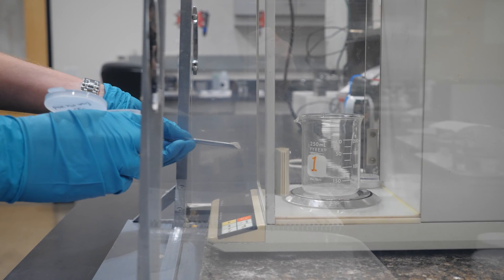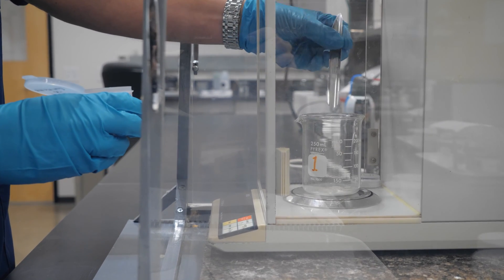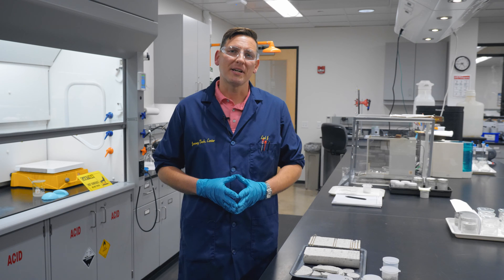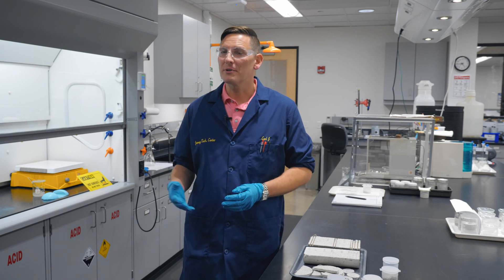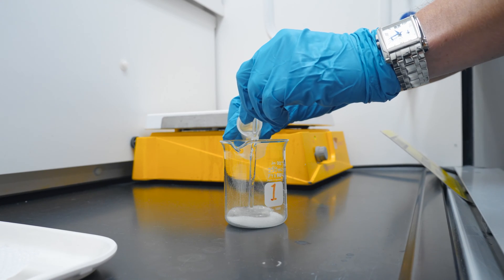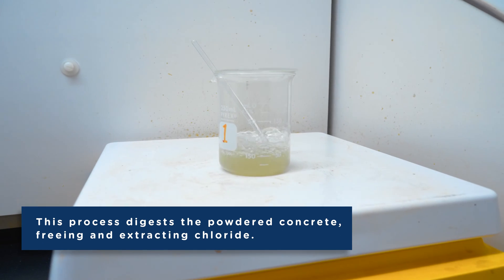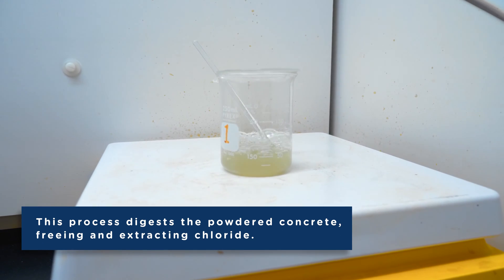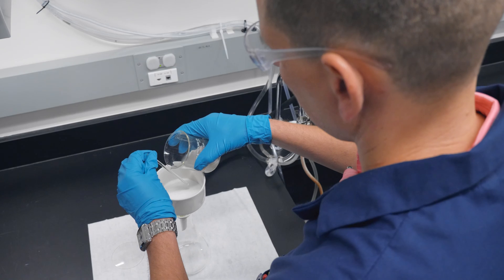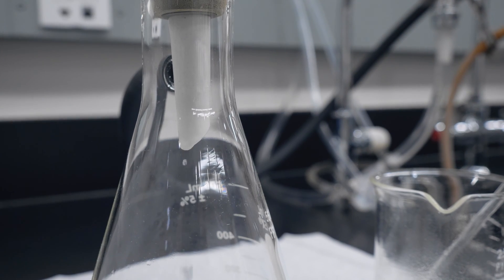In step two, we weigh these powdered samples on a highly precise digital balance. After weighing, the samples are taken over to the fume hood. We add nitric acid, bring the samples to a boil, and then it's on to step four where we filter the samples and concentrate the chlorides.